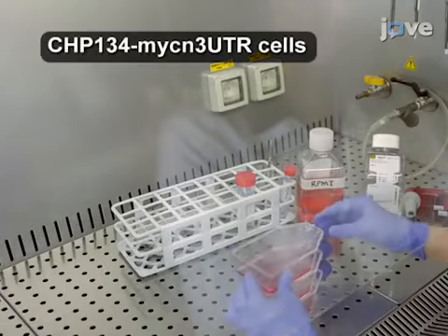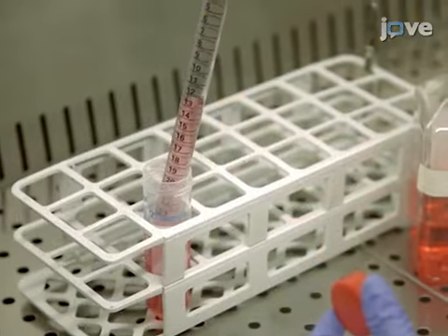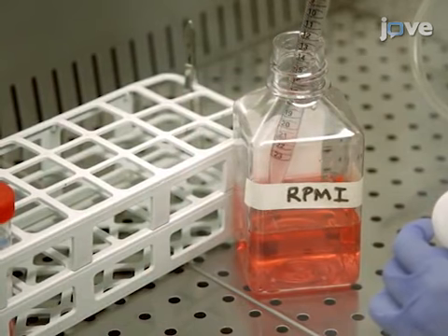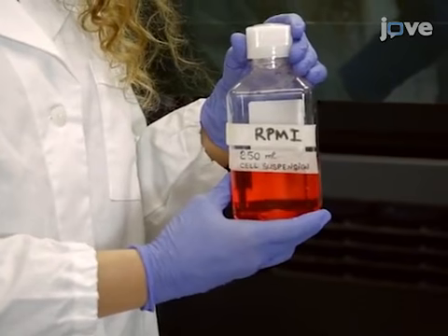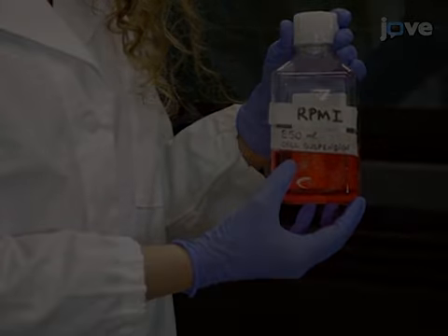Harvest the stably transfected neuroblastoma cells by trypsinization. Dilute the cells to a concentration of 2 × 10⁵ cells per milliliter in RPMI containing 10% FBS and 1% L-glutamine. For 27 plates, prepare at least 250 milliliters of cell suspension, taking into account liquid handling, trough dead volumes, and repeated pipetting steps.